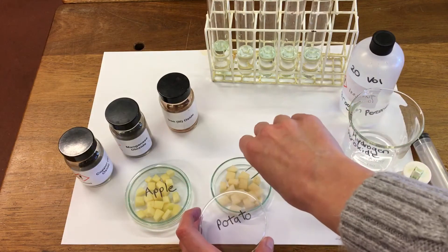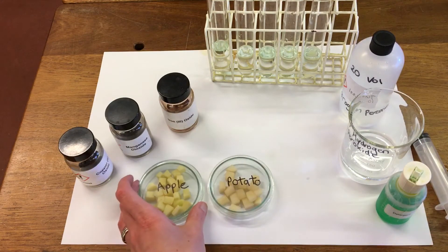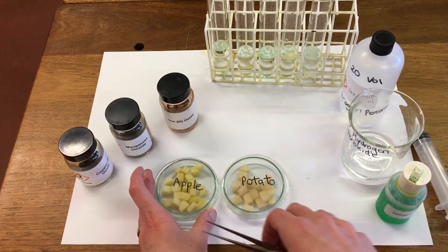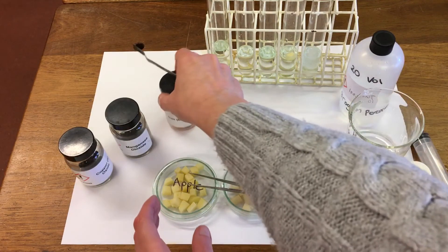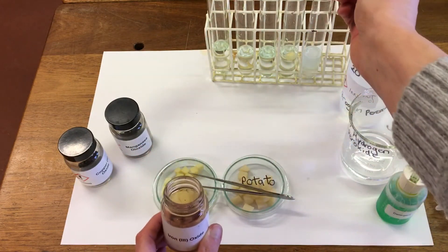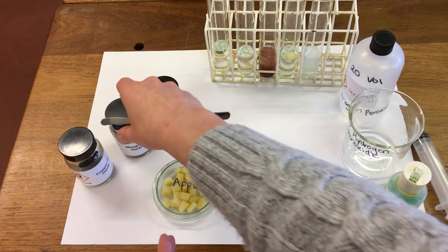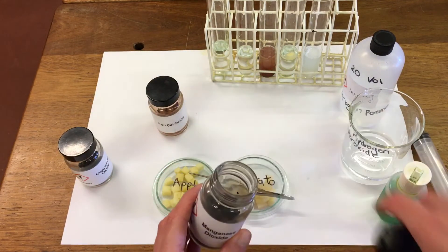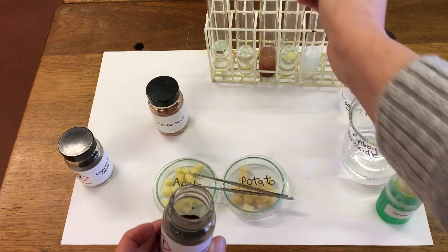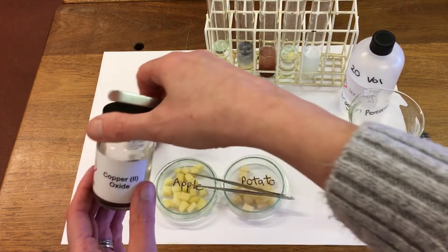The first catalyst we're going to try is potato. Our next one is apple. And then we're going to try iron oxide. Then we have manganese dioxide. And the last one is copper oxide.